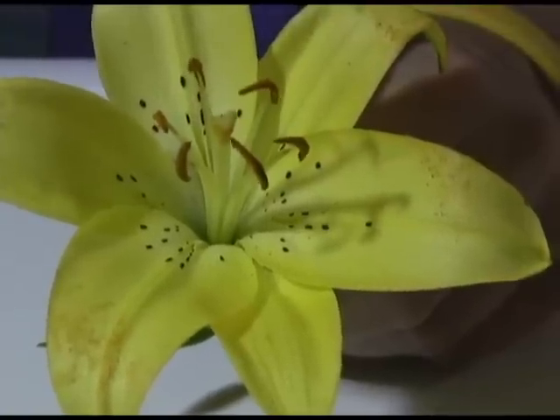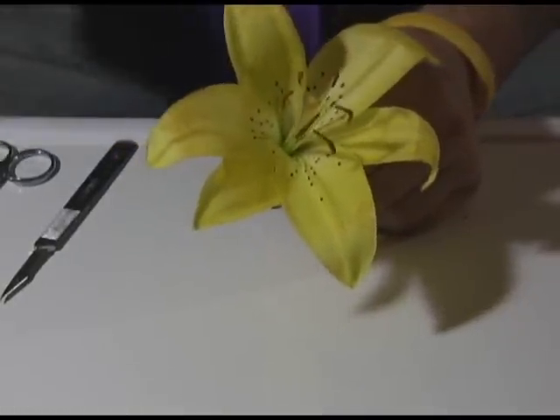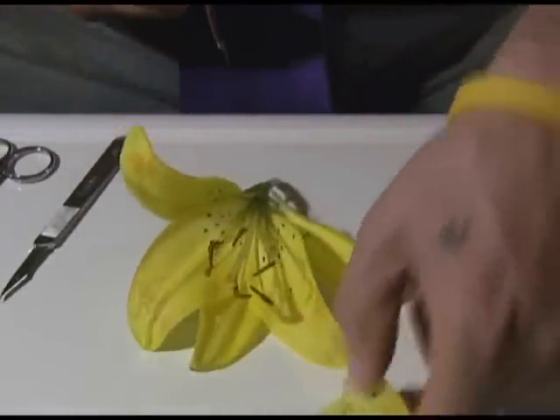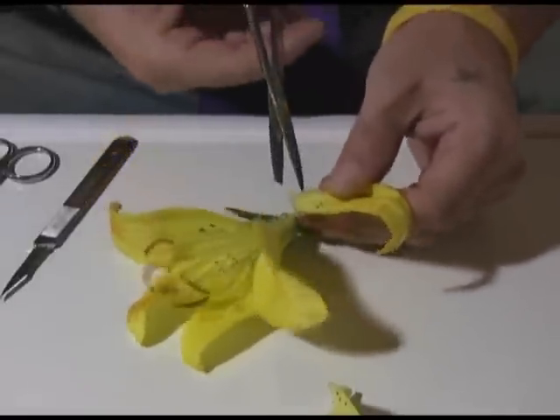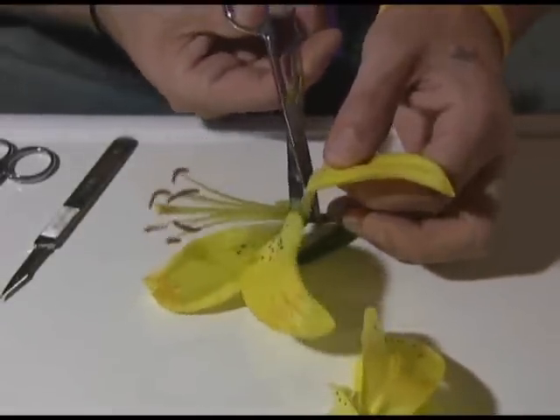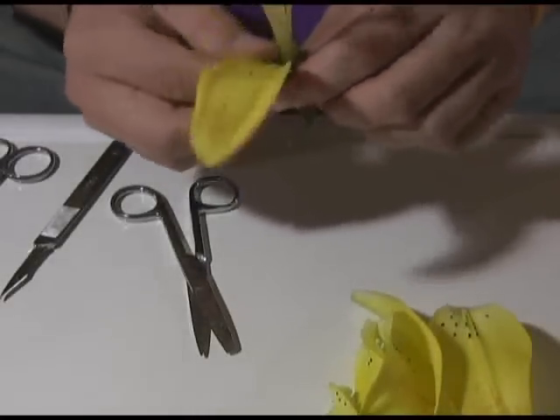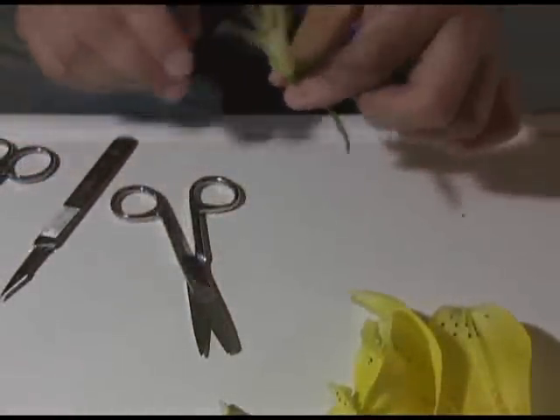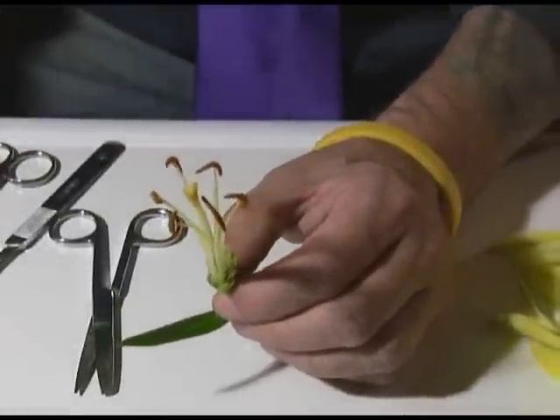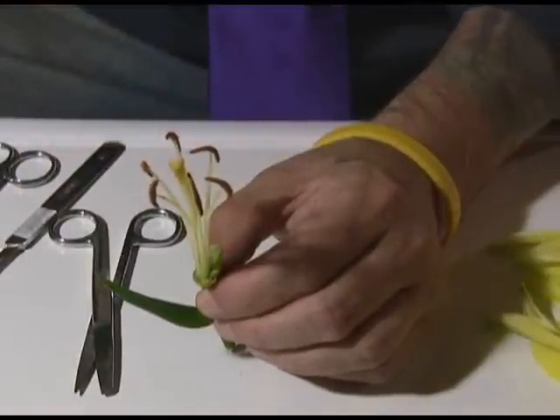So let's dissect this out. The first thing I'm going to do is take off the petals so it's easier to see. I'm going to use some dissection scissors and just cut the petals off — I could probably just as easily pull them off. Maybe we'll have a look at those under the microscope in a little bit. Now at this point you can really see the sex organs of the plant a little bit more easily. Quick review: we've got the male parts here — the stamens. There's one, two, three, four, five, six in this lily flower here.